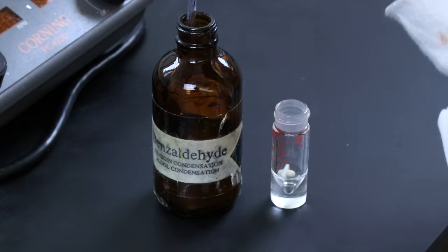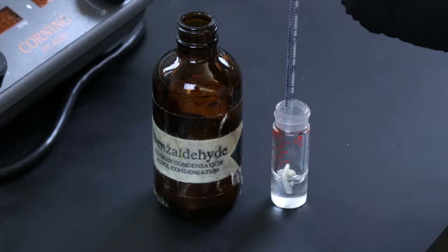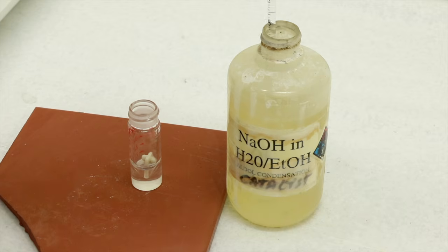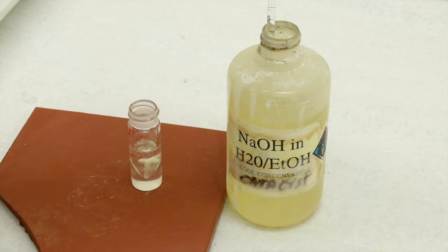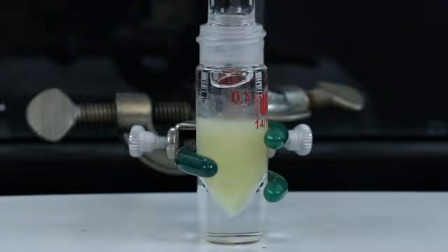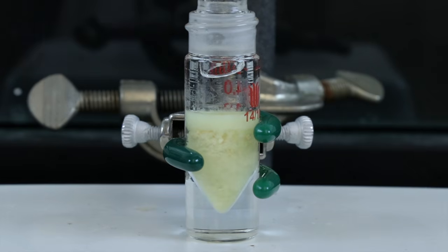I'll be adding all the reagents to the conical vial, starting with 240 microliters of benzaldehyde, and then I'll add 90 microliters of acetone. And finally, I'll add 2.5 milliliters of the sodium hydroxide, which is in a water ethanol solution. Then I'll set up the apparatus and let everything react for half an hour. And you can already start to see the yellow solid precipitating out of solution, and it'll continue to form as the reaction progresses.